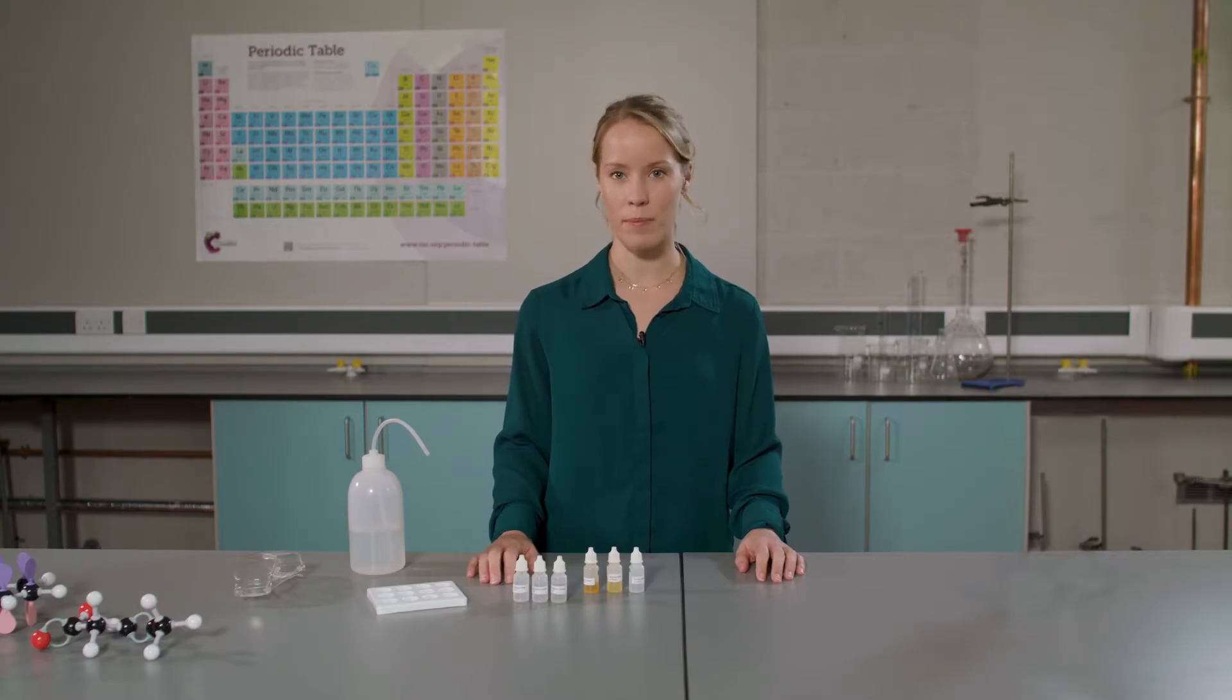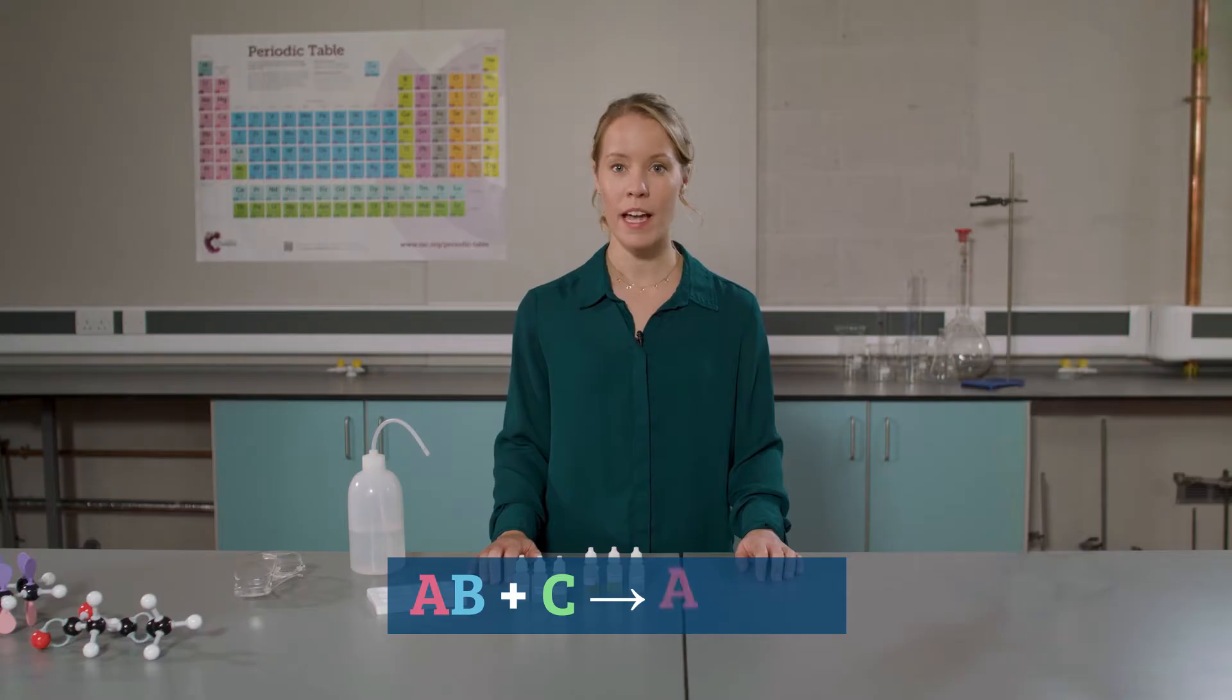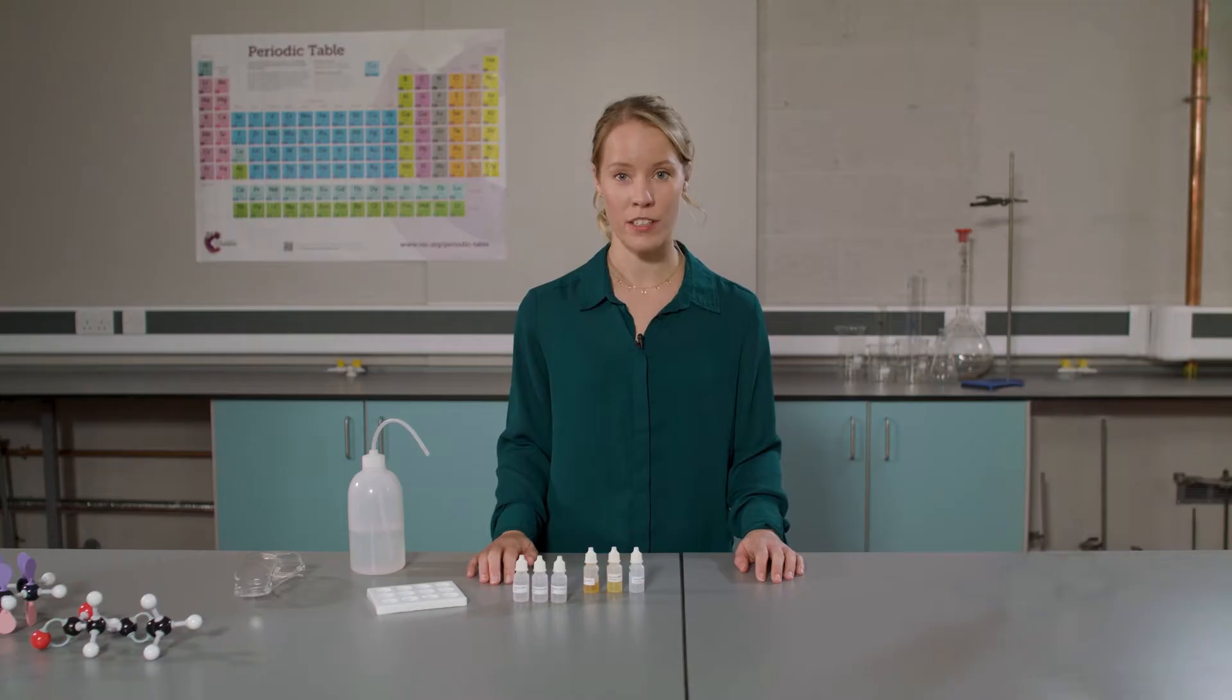A displacement reaction can be summed up using the general equation AB plus C forms AC plus B. In this practical, we are going to use a displacement reaction to investigate the reactivity of the halogens.